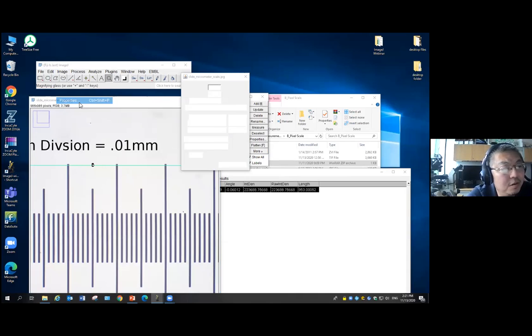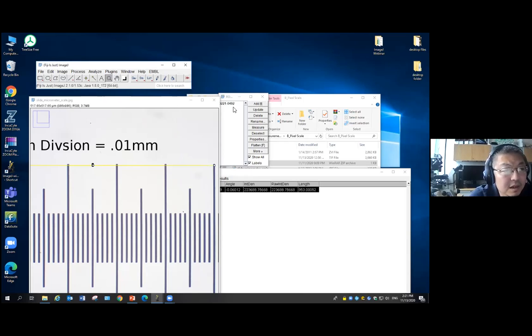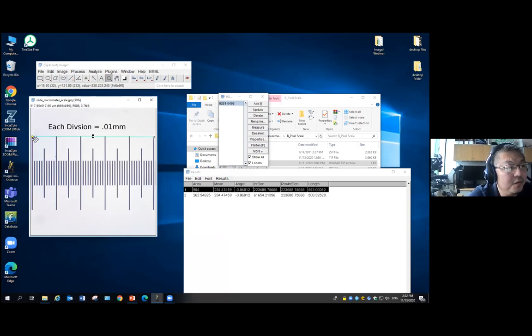So then I can go to my picture. I'm going to go to the property, then I'm going to change it here. So now I measure this again. Now this 500 corresponds to micron units, because I already changed the property. And as you can see, that is 500 micron.